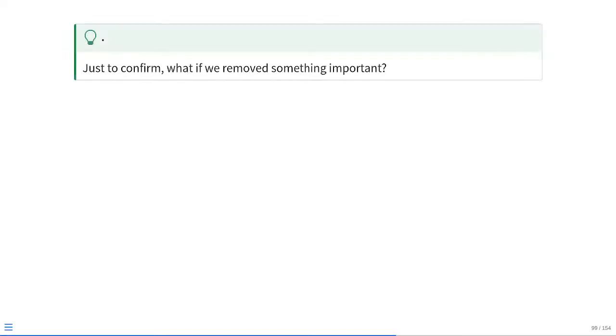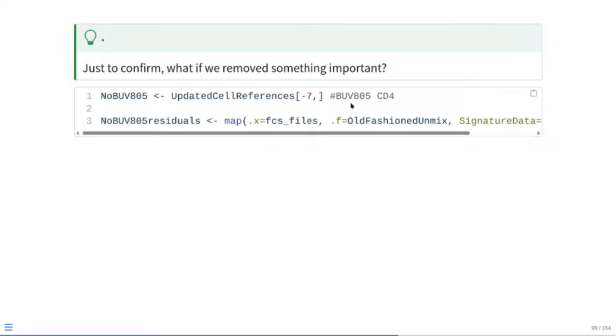Now, this was a use case where we had forgotten something unintentionally, but what happens if we intentionally forget to include something? And let's say that was something that was very important for our panel. In this particular panel, we have BUV805, which is going to be CD4. This is a mainly T-cell focused panel, so it's going to be a lot of actual signal coming from this fluorophore. So if you are looking at the existing data frame, but you use little square brackets, in base R notation, if you do -7, comma, it's going to remove that 7th row, which in this case would have been BUV805, which is basically going to subset down our data frame to not include BUV805.